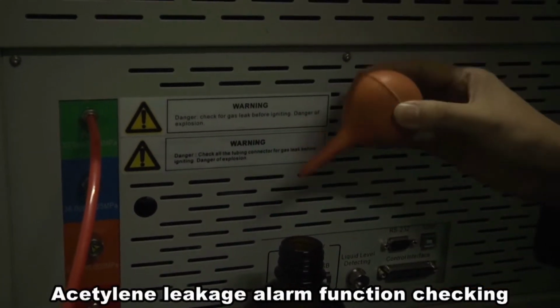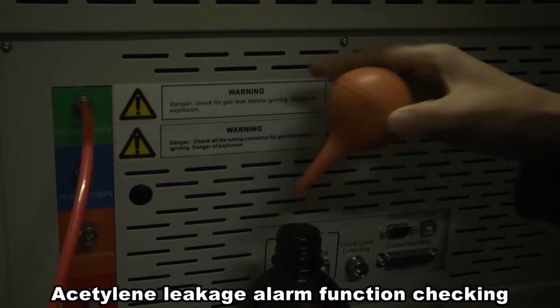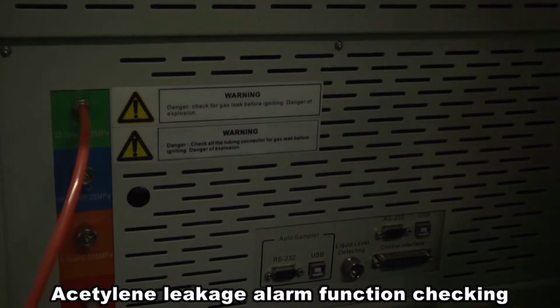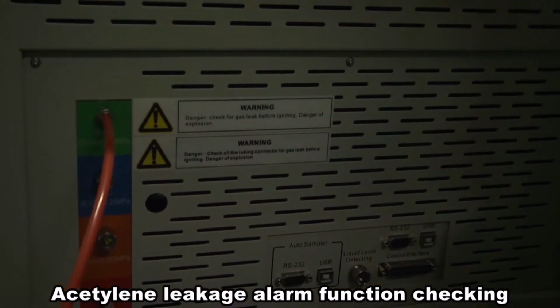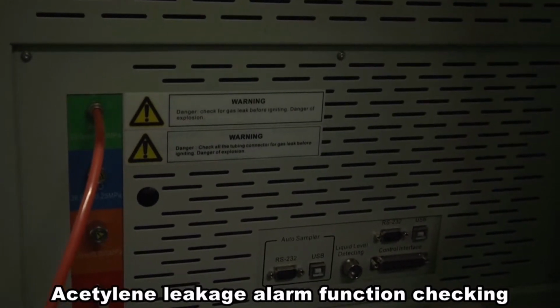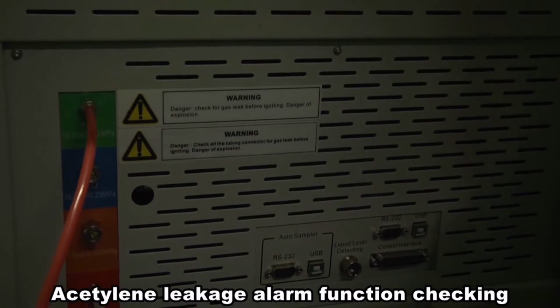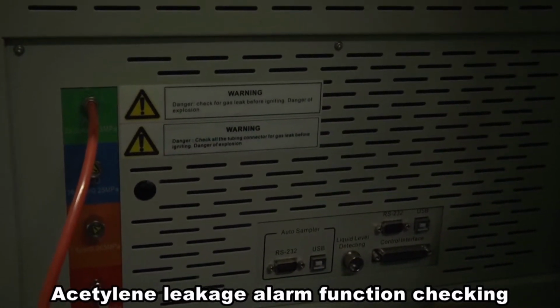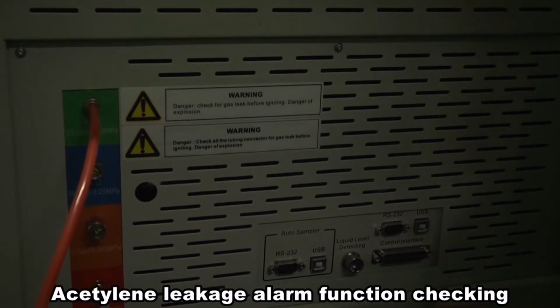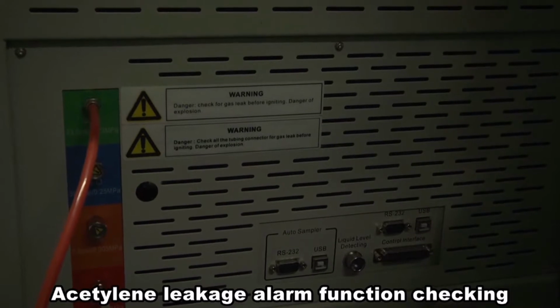Take this tool to absorb some alcohol air and blow gently to this hole. That gives an alarm for a few seconds and then stops. This is for the alcohol detecting. In case the alarm doesn't sound or lasts forever, there is some technical problem. Please see your technician service people.